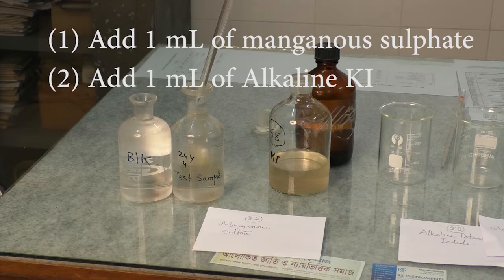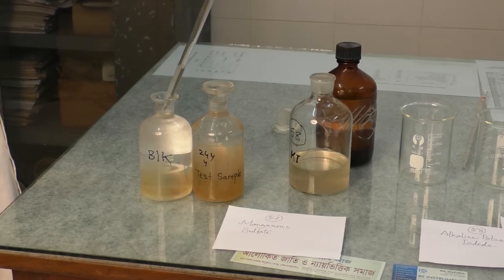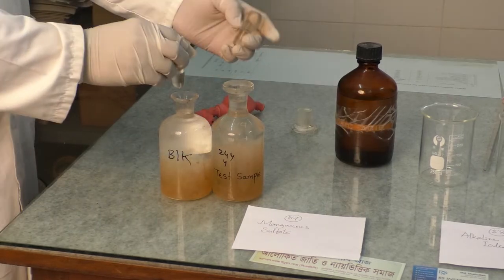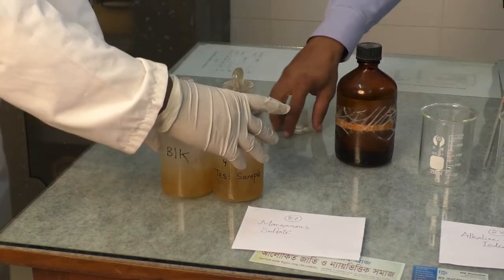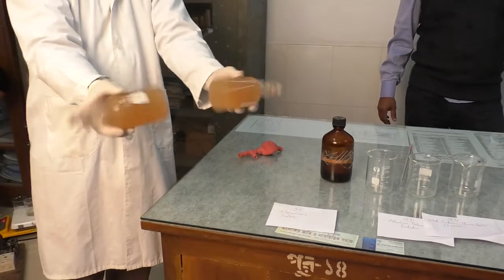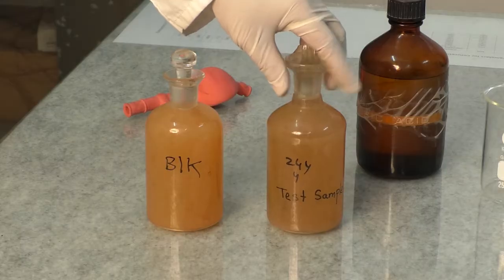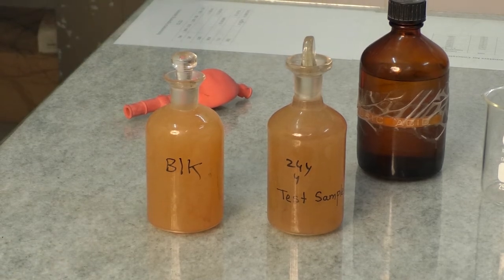At first, we will add 1 milliliter of manganese sulfate to the blank BOD bottle and the BOD bottle of the test sample. Then we will add 1 milliliter of alkaline potassium iodide solution to each of the BOD bottles. After that, the stopper will be attached, and the solution will be mixed by inverting the BOD bottle several times. Then the BOD bottle will be kept as it is so that the precipitate can settle.